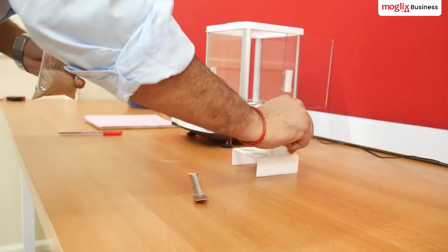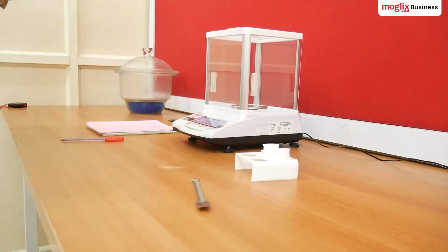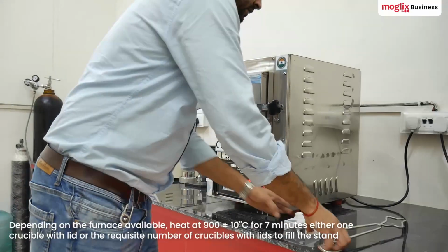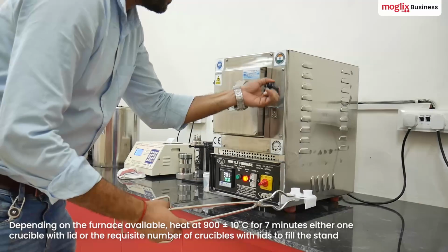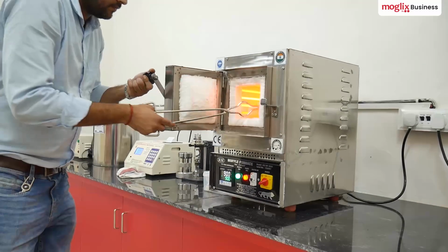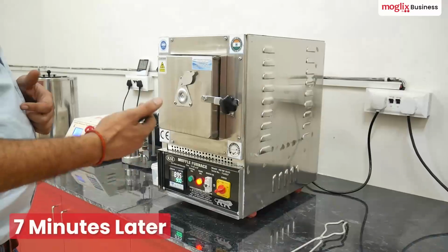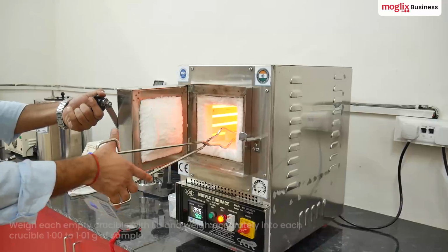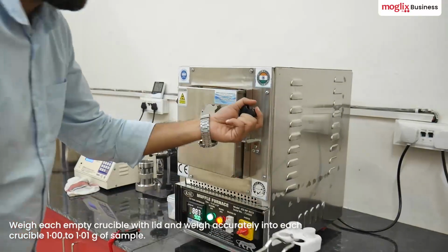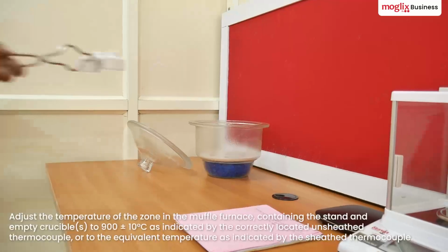Place the charged crucibles in another stand, see note. Transfer to the muffle furnace and leave for a period of exactly 7 minutes. After 7 minutes, remove, cool and weigh the crucible in the same manner as for the empty crucible. Note the nature of the residue left in the crucible.